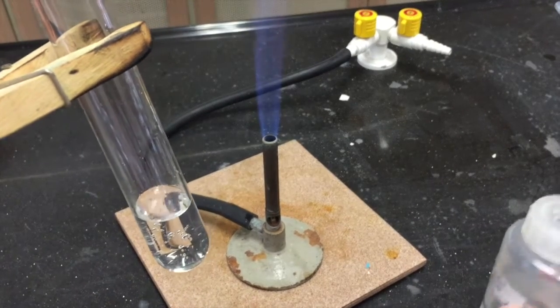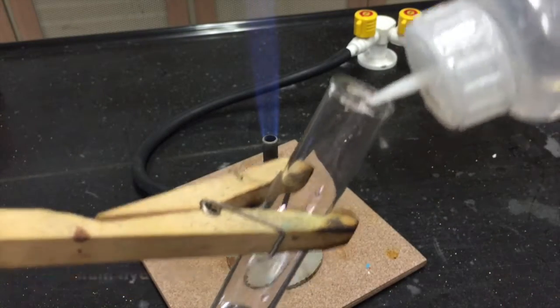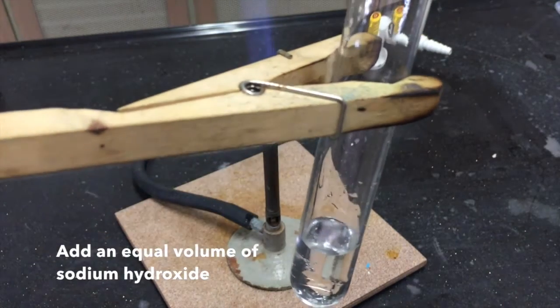To a small sample of your solution, add an equal amount of sodium hydroxide solution.